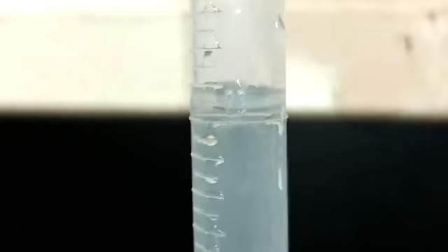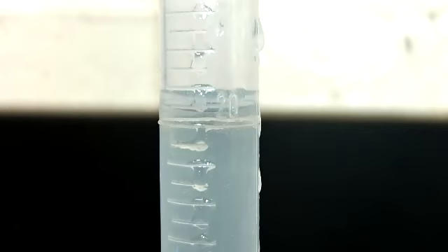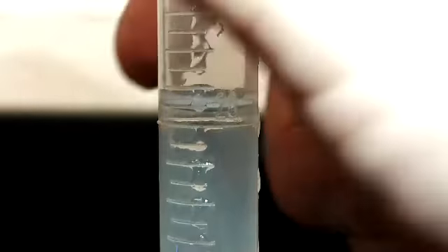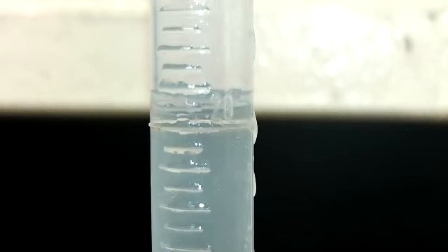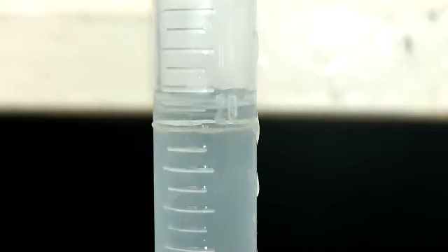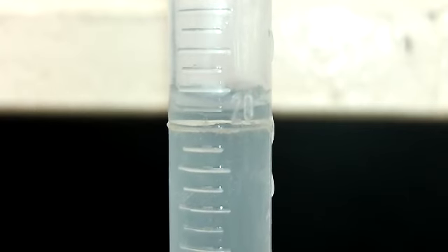Now you might notice that it didn't change a whole lot. This marble is pretty small. And if you wipe this off so it's easier to see, you might see that this marble got to, well, I don't know. What do you think? Yeah, I would say it's probably somewhere between 20.5 and maybe close to 21.